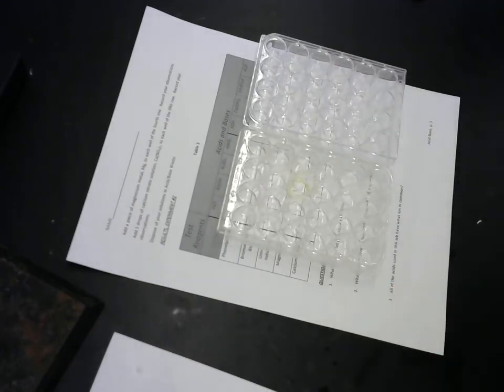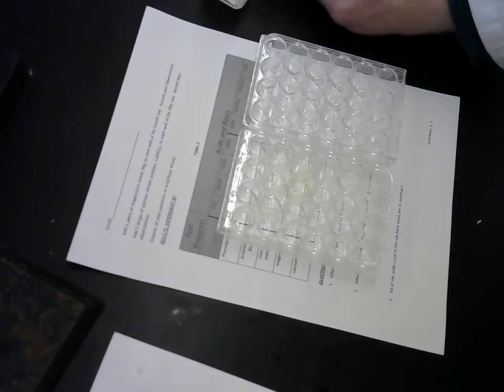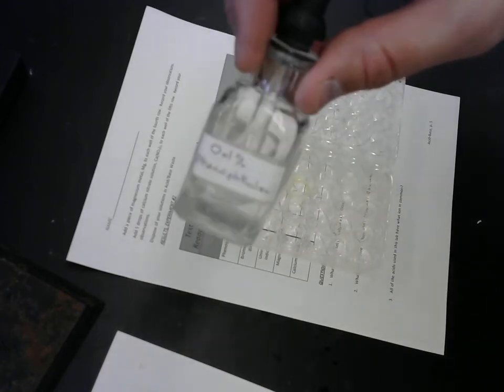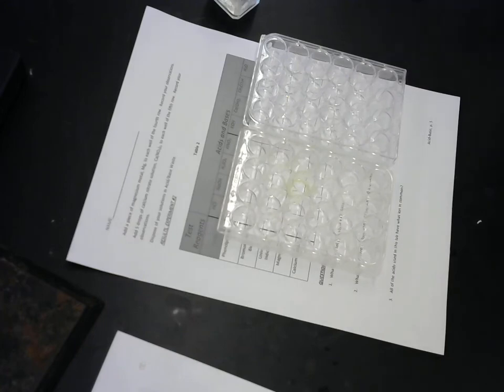And testing what happens. So the first is phenolphthalein. Phenolphthalein has the fantastic quality of combining 4 consonants in a row within its name, but it will also act as an acid-base color indicator. So under neutral and acidic conditions, phenolphthalein is colorless, as you see in the reagent bottle here. Under basic conditions, it is going to turn pink. Lily, would you like to put a couple of drops of phenolphthalein into the top cell of each column? Okay.